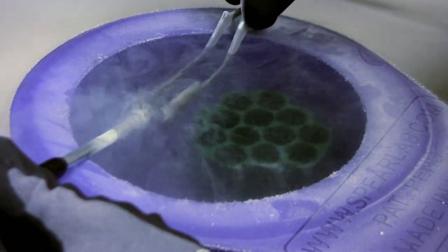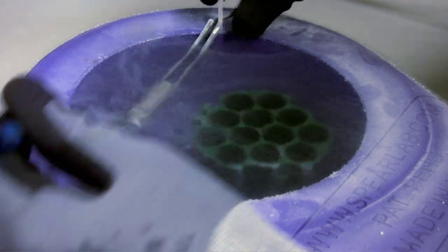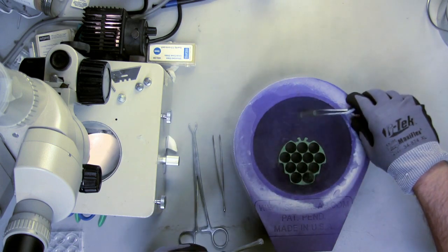Notice the angle going into the tongs is pretty flat and tricky to navigate. I found that having the liquid nitrogen level as high as possible in the dewar makes things much easier.